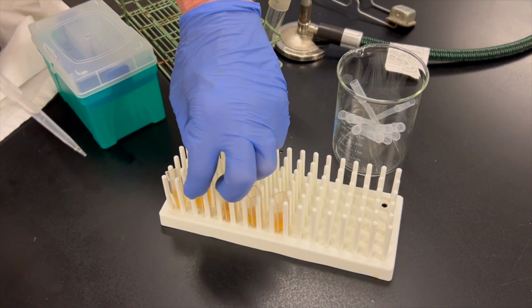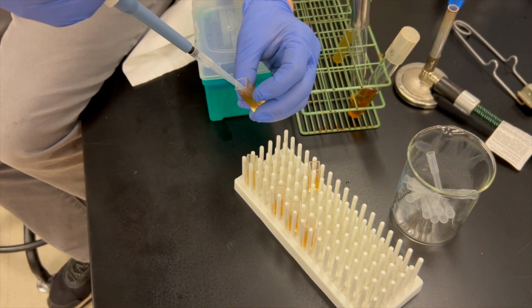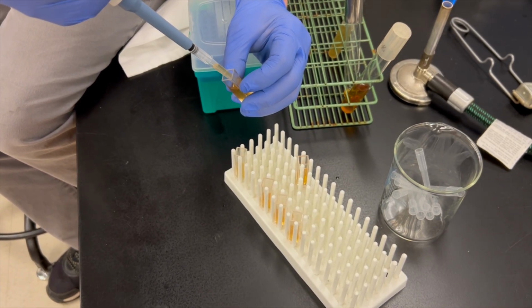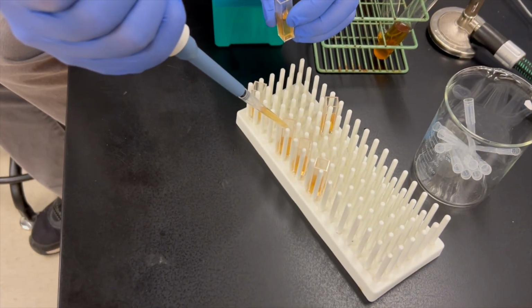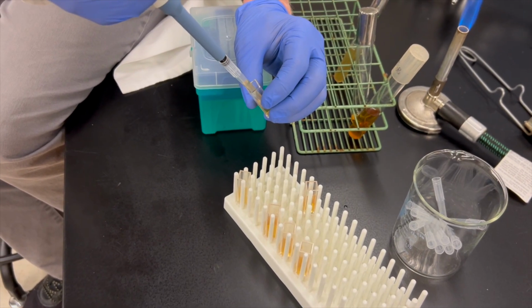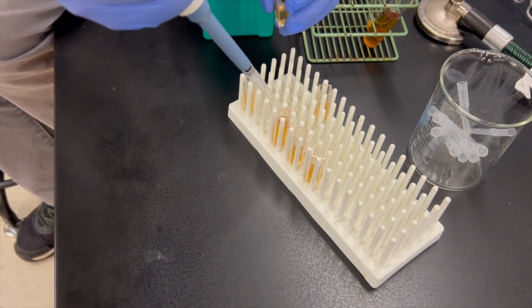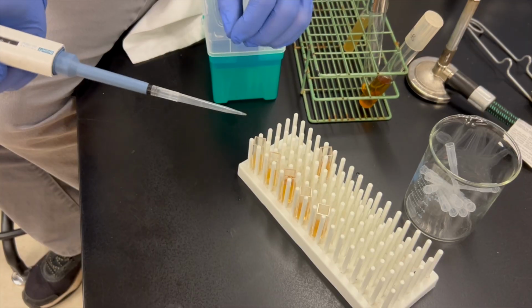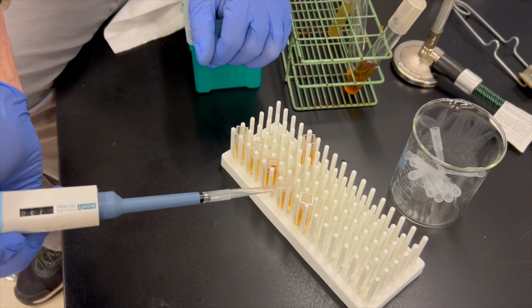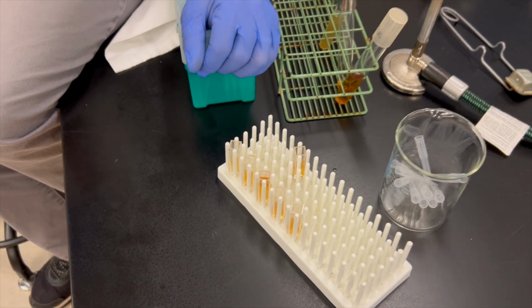So now what I want to do is take this, and we don't have to worry about sterile technique as much because we're not going to be incubating these. I'm just going to pipette up gently a little bit, and then ultimately take 1.5 mLs or 750. We'll put it in here, and we'll have to do it a second time to make it 1.5 mLs. And I'm going to continue with that same process, 1.5 out of here mixed to here, 1.5 out of here mixed to here. And at the end, I will have 3 mLs in this and 1.5 mLs in all of those tubes.